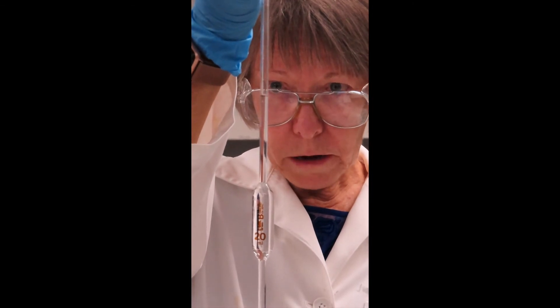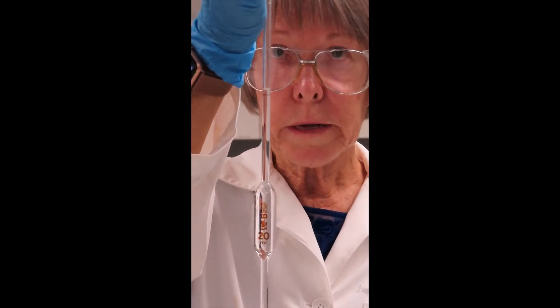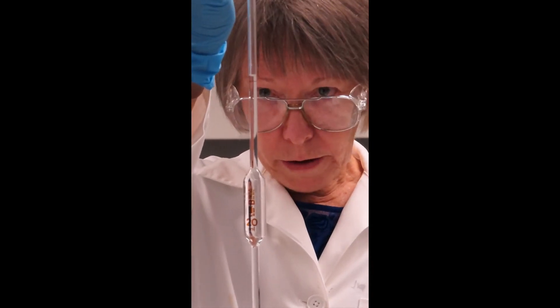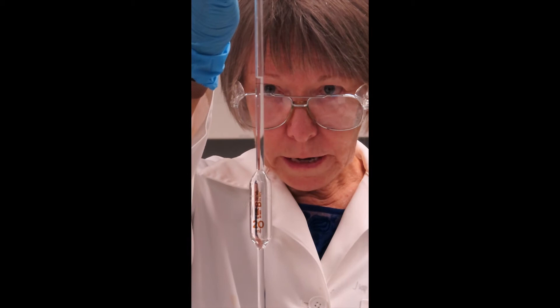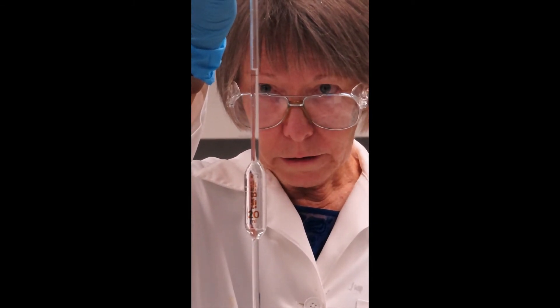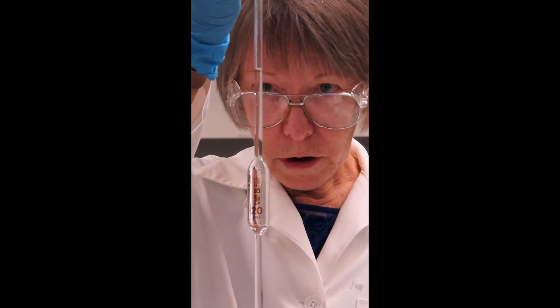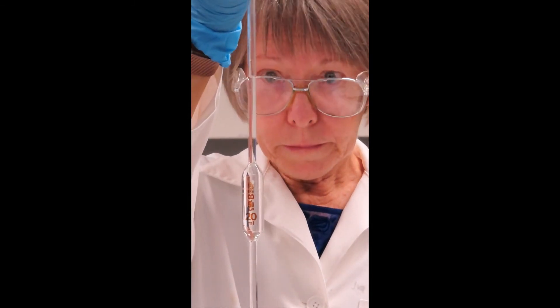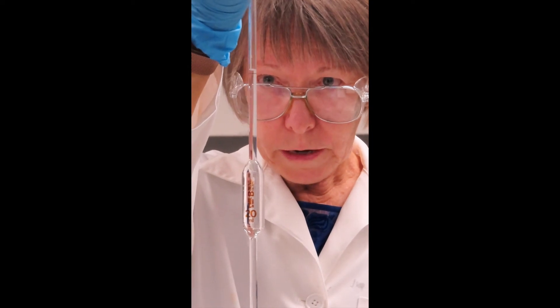So we take it up above that mark, just a little bit, and then the third valve which says E, evacuate, we squeeze that gently just to bring the meniscus down to the line. Make sure your eyes are level. If you go down too far, suck up a bit more.